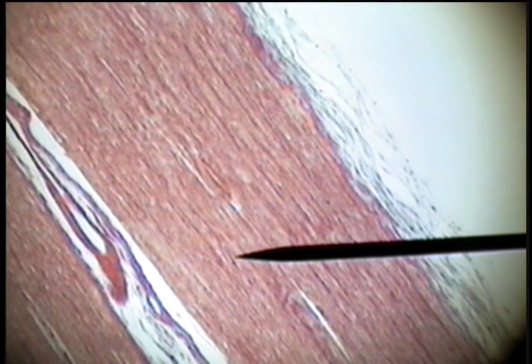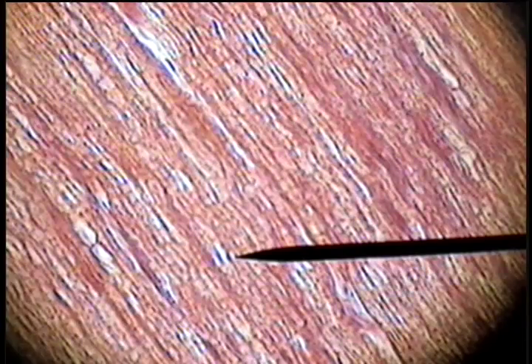If we go back to the longitudinal tissue, we might be able to see the Schwann cells, which are the cells that give rise to the myelin. They have an elongated nucleus found along the exterior of these cells. This dark, flat nucleus right here would be a Schwann cell. Here's another one — these flat, dark nuclei are Schwann cells, producing the myelin.